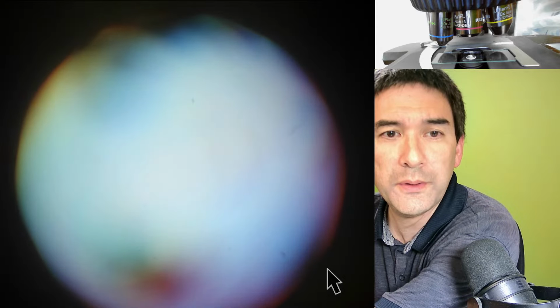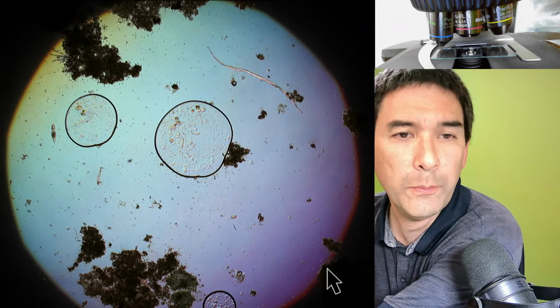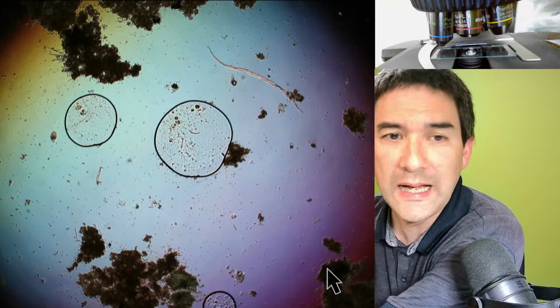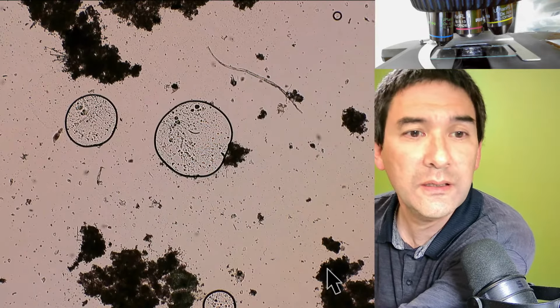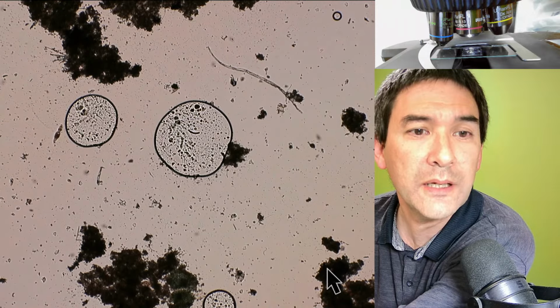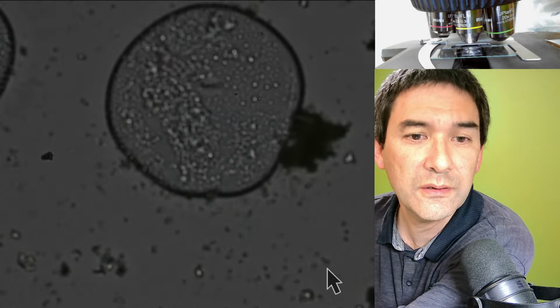You can actually see the thing, so that's already the 10 times. Normally you always start focusing with the 4 times. And I have to open this here. You still see a whole bunch of clusters. The chlorella algae were also in tablets. And the thing that surprises me a little bit, and I don't understand this, is there is even some movement going on here. You see this?